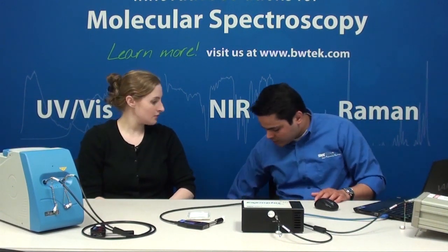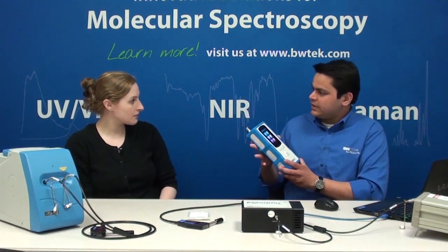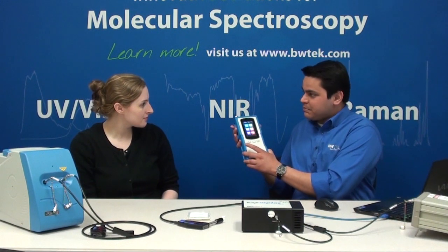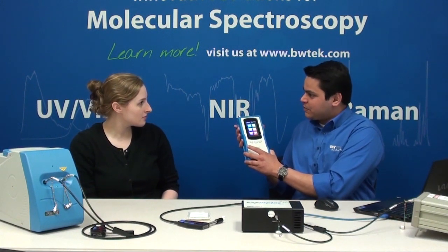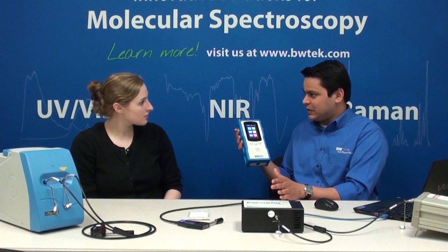So as far as all these components, would they all be found inside this Raman system here? Yeah, you would have similar components inside a Raman system. Now, the latest trend in Raman spectroscopy is actually these handheld analyzers, which are simple pass-fail machines, and they're extremely easy to operate for both the technical and the non-technical user.